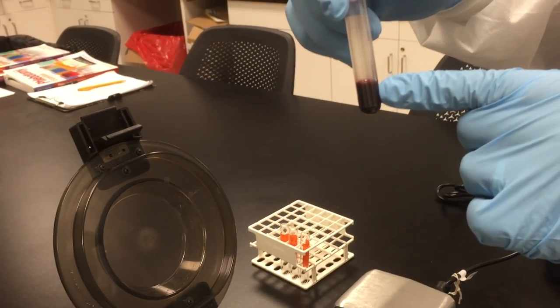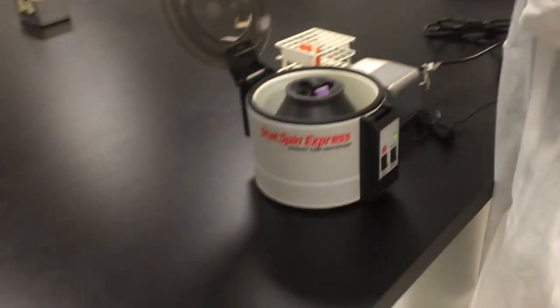This right here concludes the operations of a centrifuge.